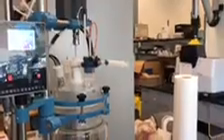Okay, so we have other things here that we've actually gone through with a lot of trial and error, but now here's a quick overview of the 3D printed parts that we have. One would be the holders, or the bracket for the pumps here, for our influent and our effluent pump. We've got this, which is our primer holder. We'll get into this right up here.